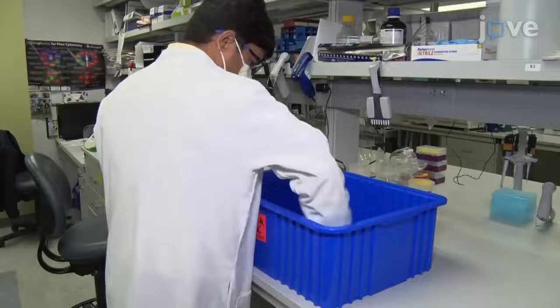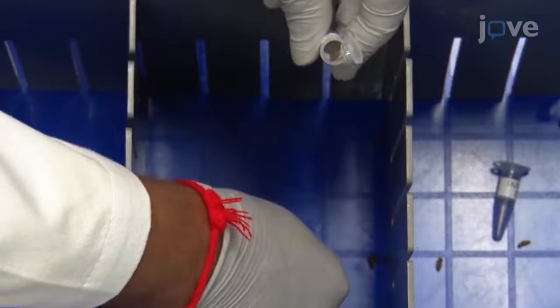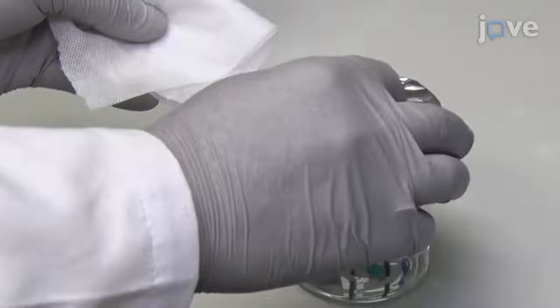To begin, sterilize the divider boxes with 70% ethanol. Place the mice in sterilized divider boxes and allow them to defecate normally for up to one hour. Use sterile forceps to collect the fecal pellets in an empty pre-labeled 1.5 milliliter microcentrifuge tube and close the tube securely.